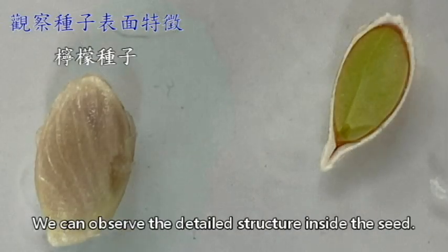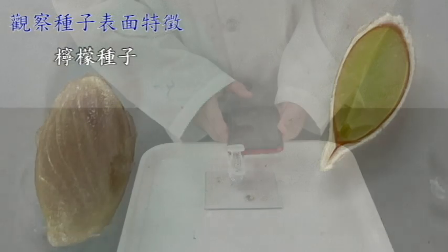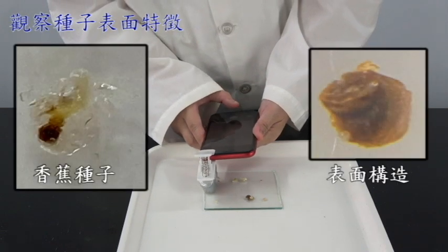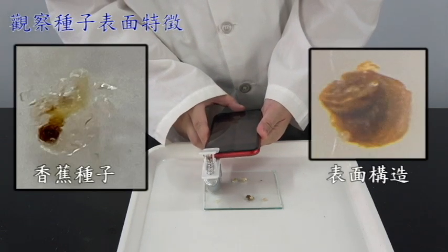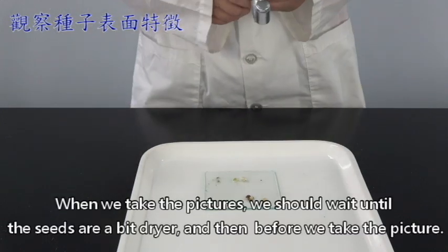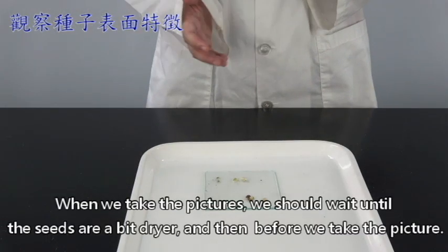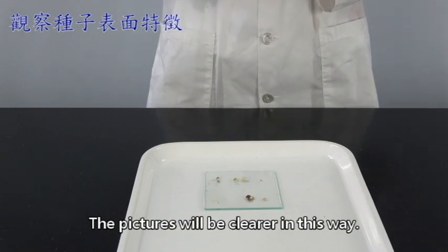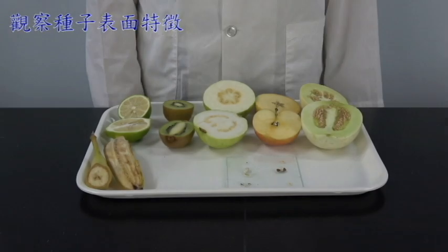If there are seeds that have been cut in half like this one, we can observe the detailed structure inside the seeds. Next, the sixth one. When we take the pictures, we should wait until the seeds are a bit drier before we take the picture. The pictures will be clear in this way.